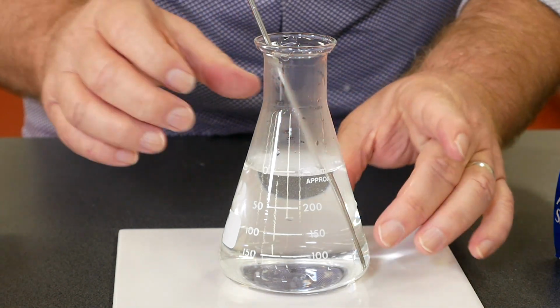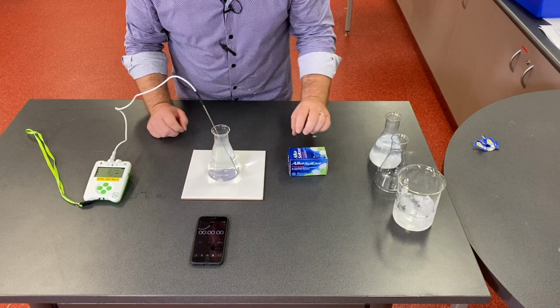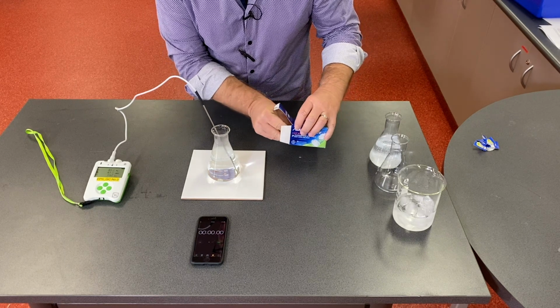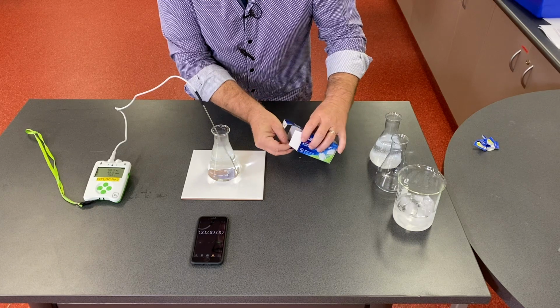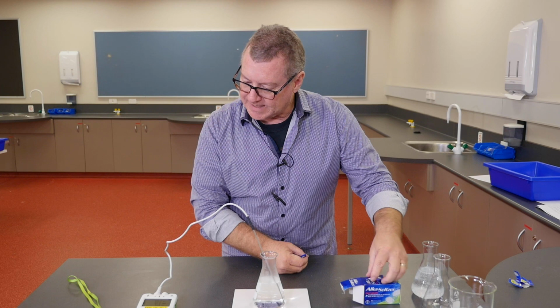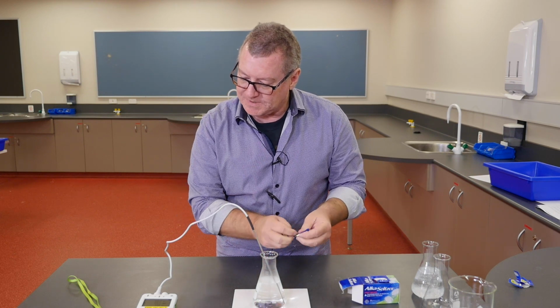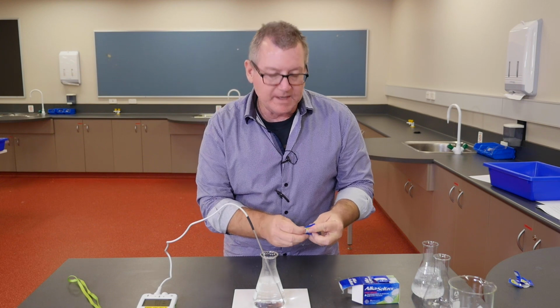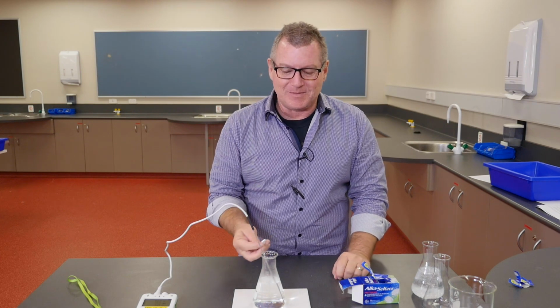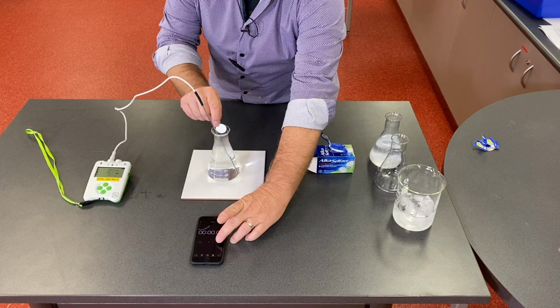So we'll find out whether our lab is compliant, and we'll reset the clock in the meantime. So it's stabilised at about 50 degrees. 50.0 degrees, and it seems to be quite stable at that. So what we predict is that this will be a lot quicker. It won't take 36 seconds. So I'm going to have to be quick on the stopwatch, and we'll see how long it takes at this significantly higher temperature.